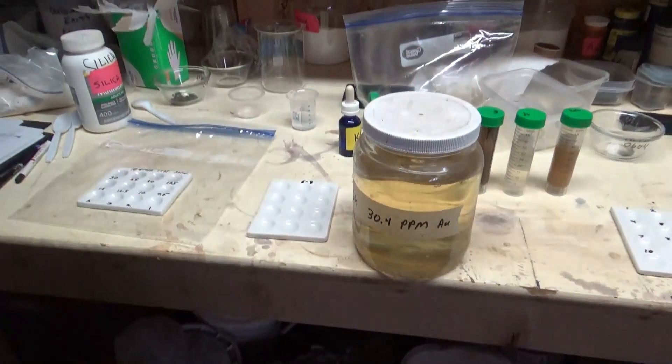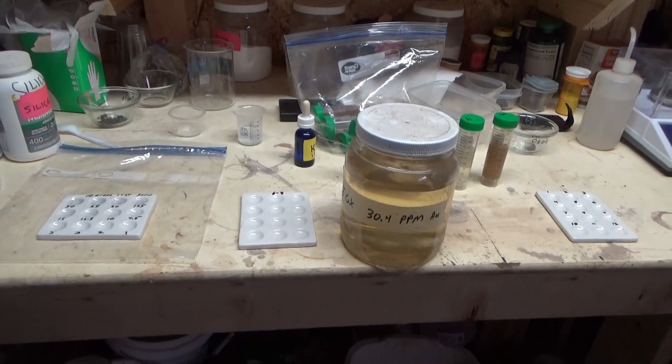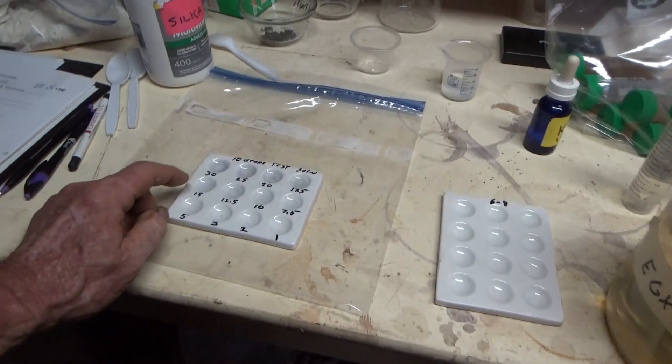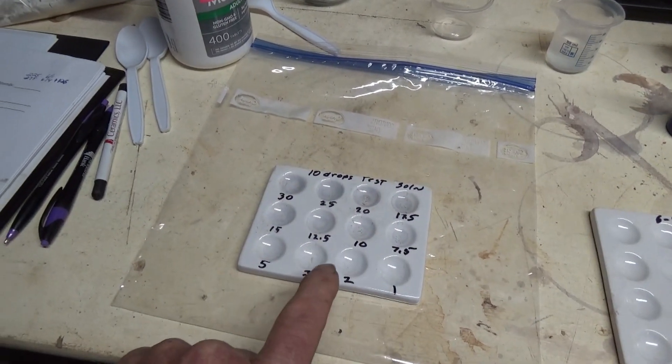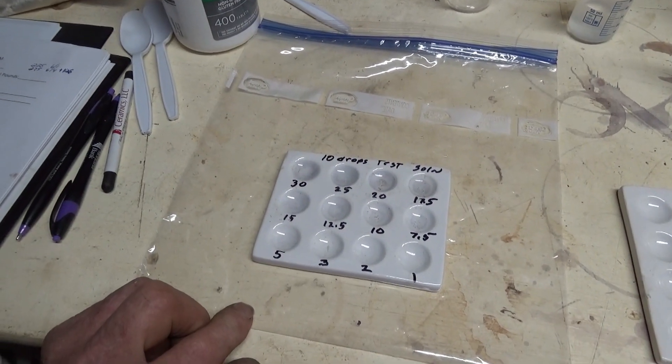Now this solution was assayed at 30.4 parts per million, and then by various dilutions we got various concentrations of solution.